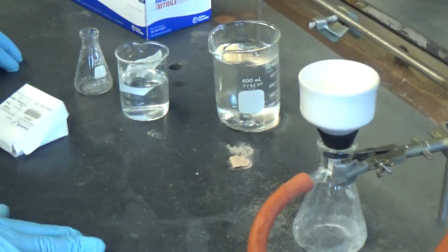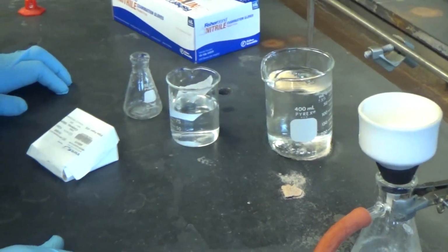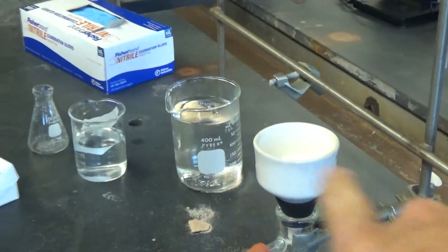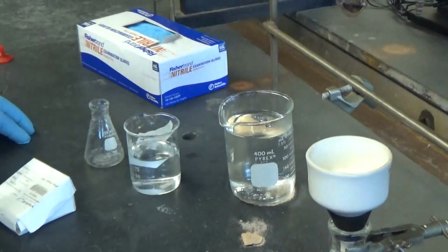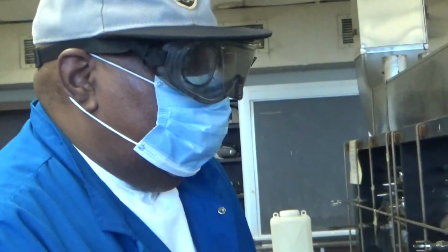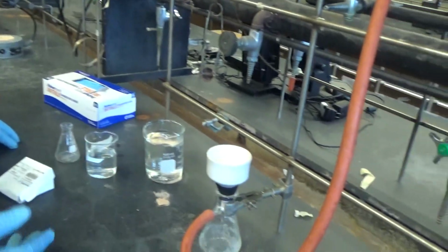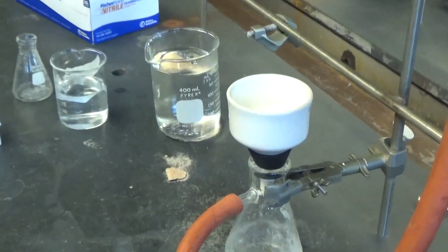I think, just thinking out loud, if you would have decanted it and then had this already ready to go, and then immediately poured it, actually, no, you don't want to do that because it might be still hot. I don't know. I think you get a little more yield. Yeah, but in OChem2 lab, the experiment we are doing, the molecule we have there, we need to do that. For OChem1, that's still alright. Yeah, that's fine. Your yield looks good.